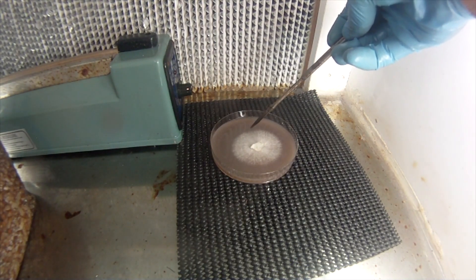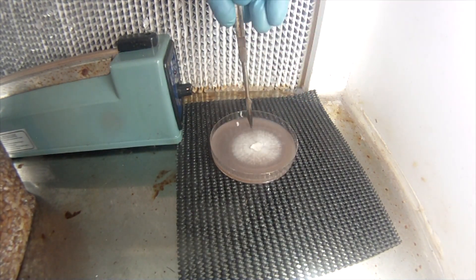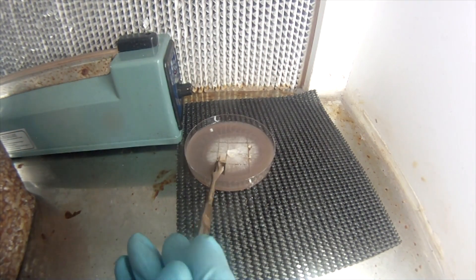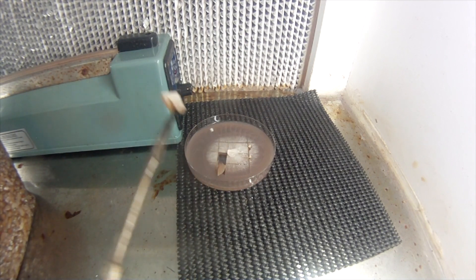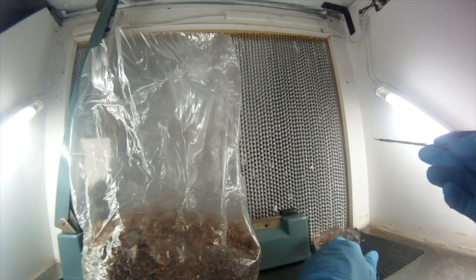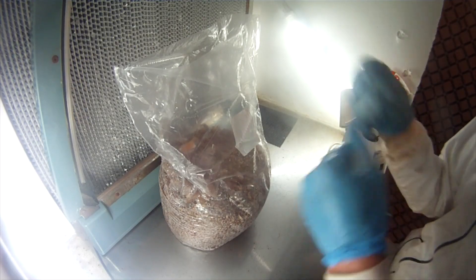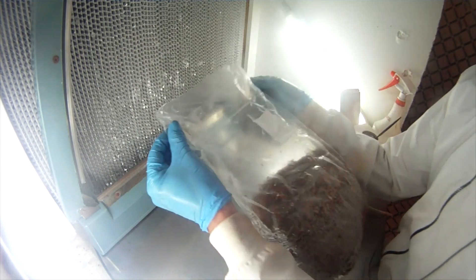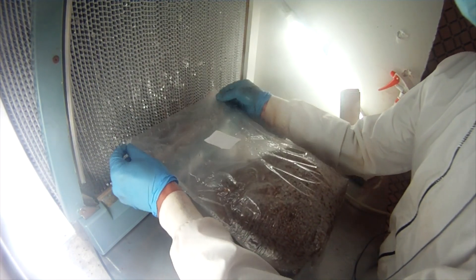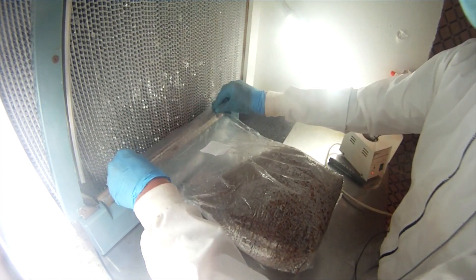Here's a closer look. This one obviously has a massive margin — you don't need that much. We're just going for the mycelium. This is our last dish. Pop it on out of there and put it on in. So we've done all of our mycelium; there's a bunch of chunks of agar in there with the mycelium. Now we're going to close the bag. Make sure you fill the bag with air — this is a laminar flow, so that's clean air going into the bag, keeping it clean but giving it some oxygen.